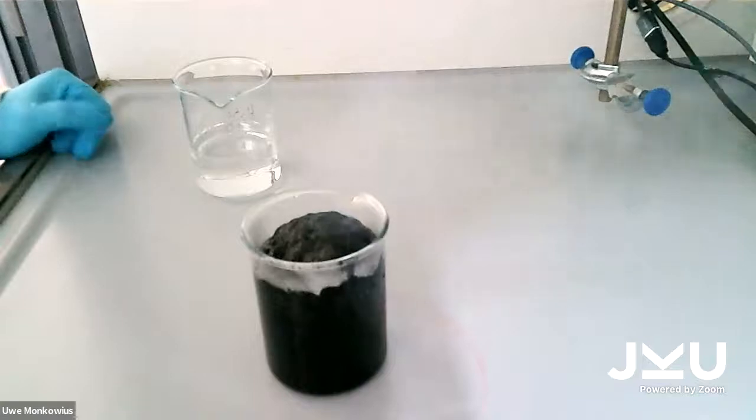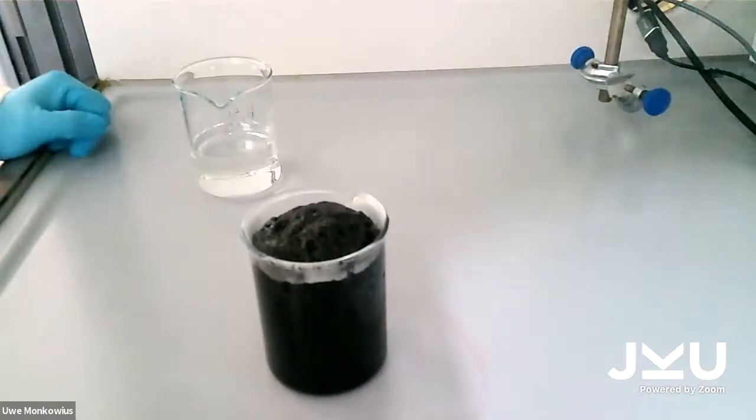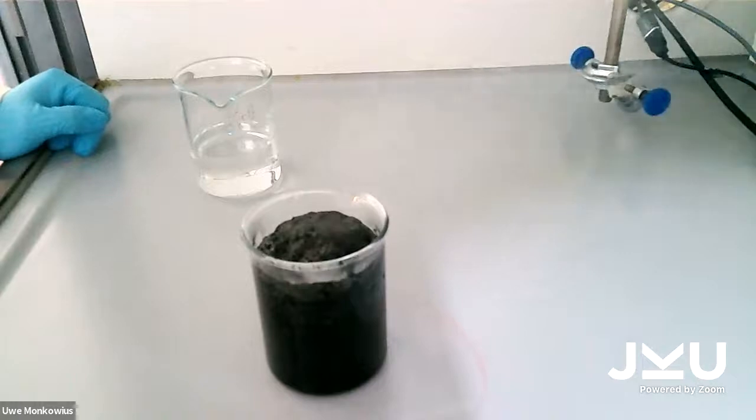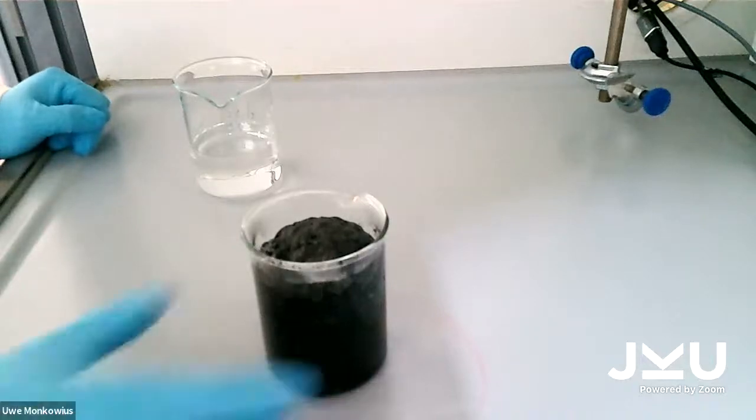The reason for that is that the reaction is really exothermal, and the hydrates make water vapor, and also the sulfuric acid oxidizes the carbohydrates a little bit, making also CO2 and other kinds of compounds that evaporate.